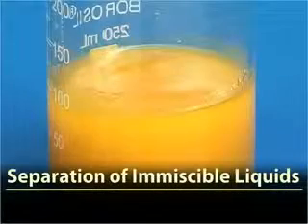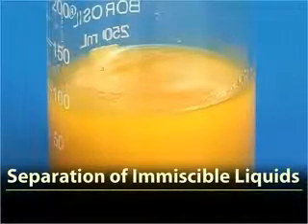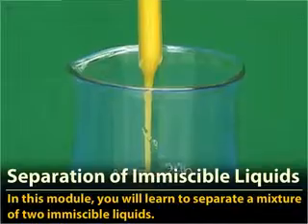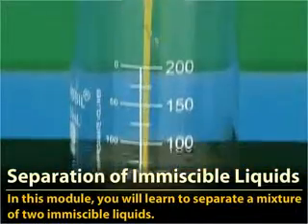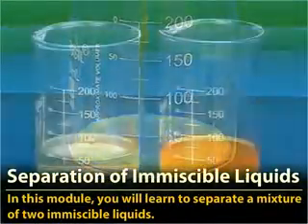Separation of immiscible liquids. In this module, you will learn to separate a mixture of two immiscible liquids.